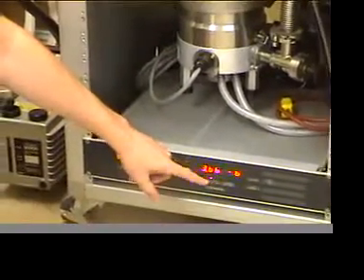Before you can begin your experiment, you need to make sure that this number reads on the order of 10 to the minus 7th torr.